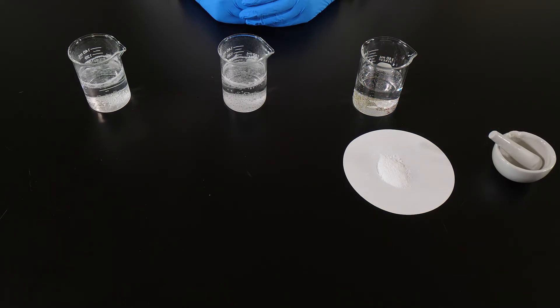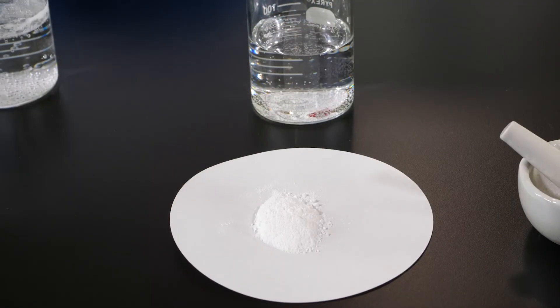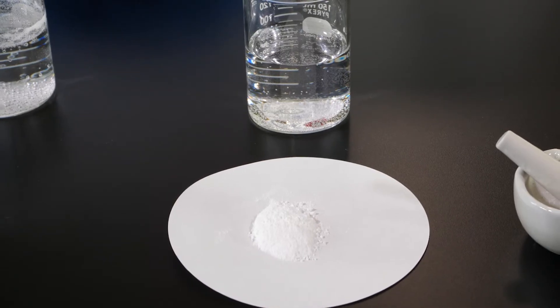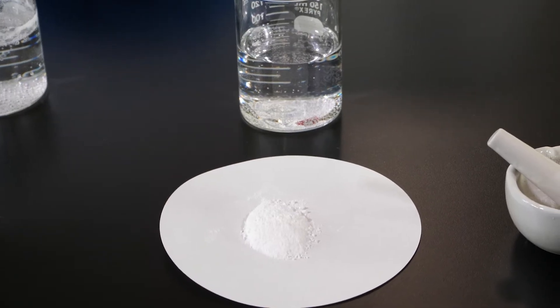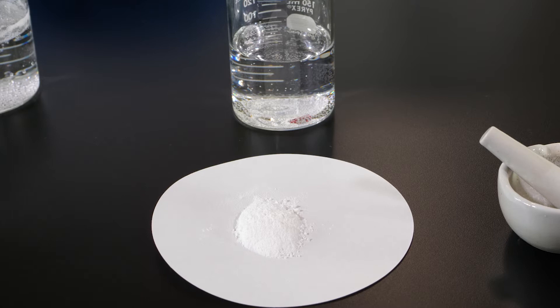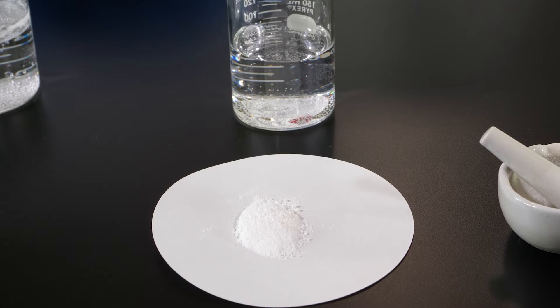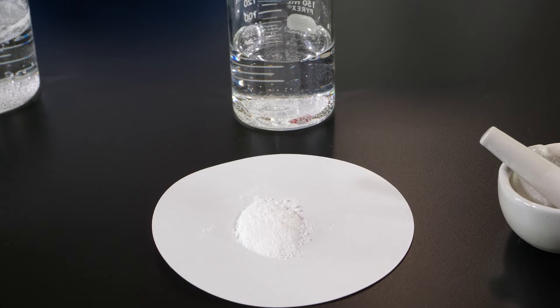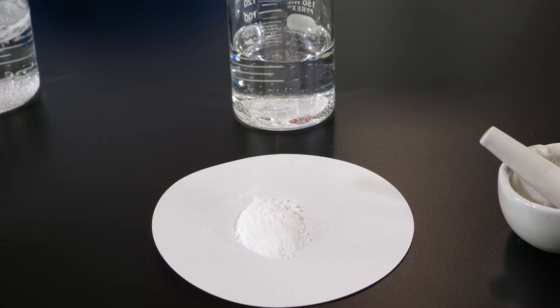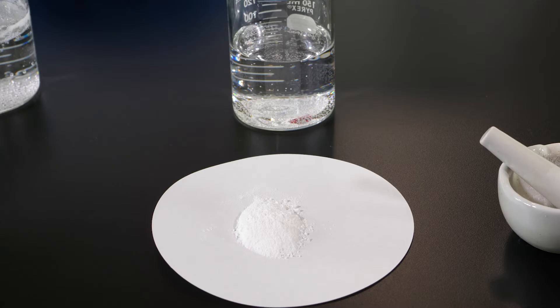For our third test, an effervescent tablet has been crushed into powder. The tablet has the same volume as each of the previous two tablets, but its surface area has been greatly increased. This powdered tablet represents food that has been thoroughly chewed.